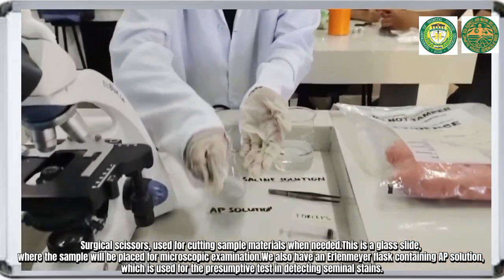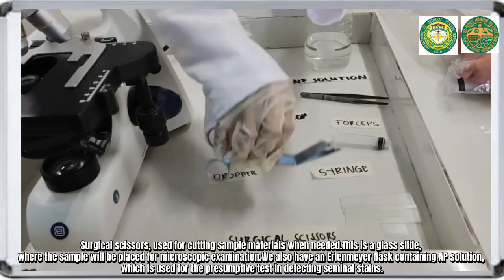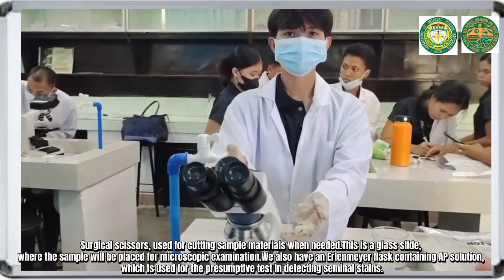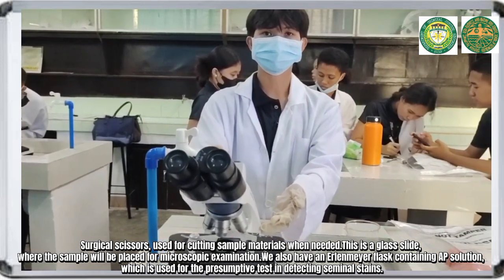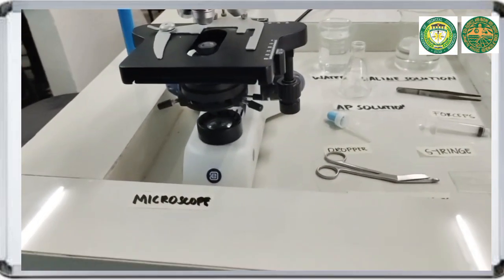We also have an Erlenmeyer flask containing AP solution, which is used for the presumptive test in detecting seminal stains. We have the microscope, which is essential for observing sperm cells and confirming the presence of seminal fluids.